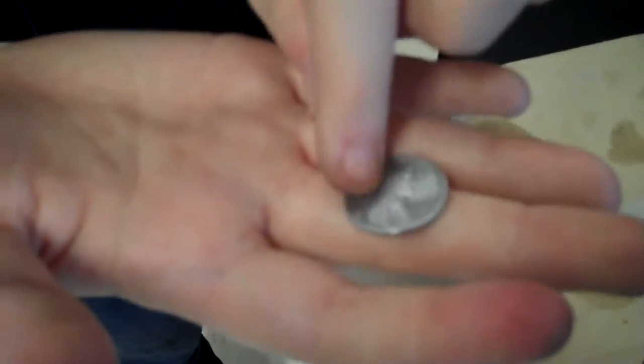Hey, why do you have so many pennies? Now let's see what we've got here. There you go. Okay. Now the penny looks like a dime. Some people would say it's silver, but it's zinc. Zinc colored because it's zinc coated.